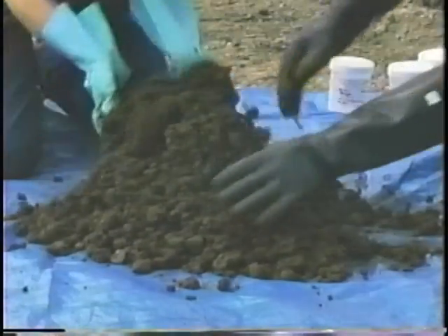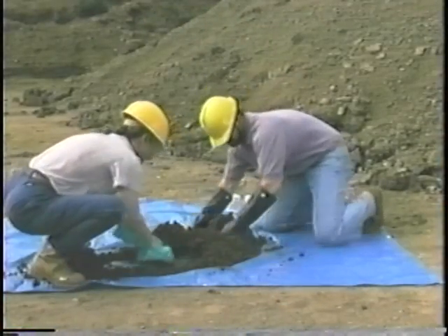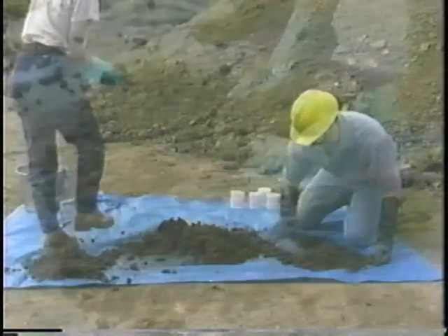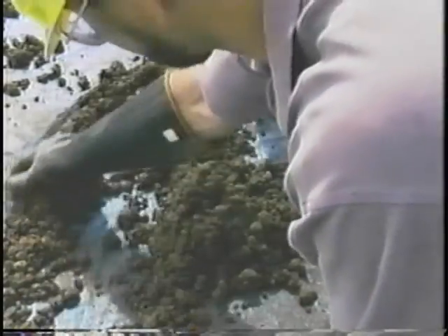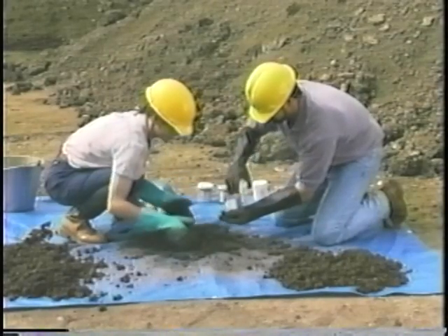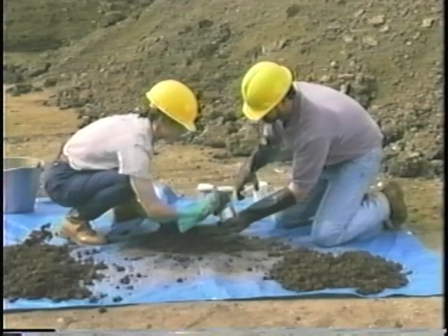The cone and quarter method is another procedure commonly used to reduce a large volume of sludge to the volume needed for sample analysis. Pour sample aliquots onto the center of a clean plastic sheet, forming a cone-shaped pile. The pile is then quartered, and 2 quarters are randomly selected to be discarded. The remaining quarters are reshaped into a cone and quartered. This procedure is repeated until the sample volume is roughly the amount needed to fill the sample containers.